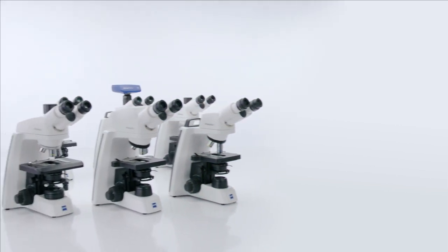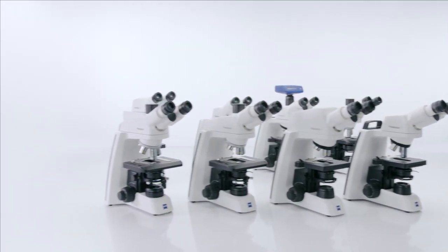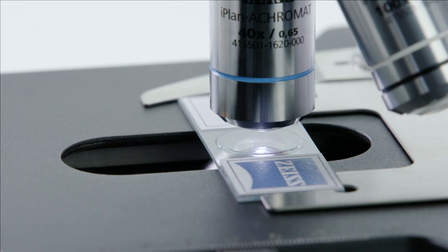How to change illumination with your Zeiss PrimoStar 3. Sometimes, depending on the application you're using and the results you want, you may prefer different types of light sources.